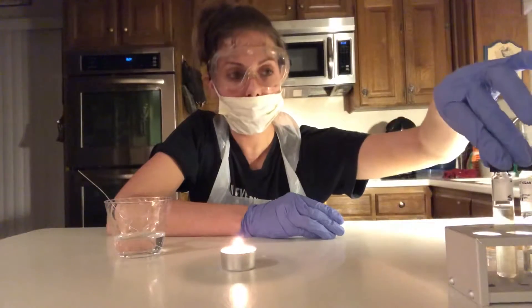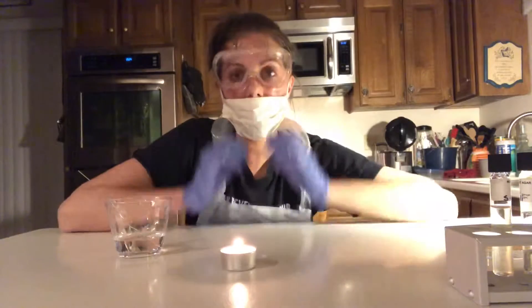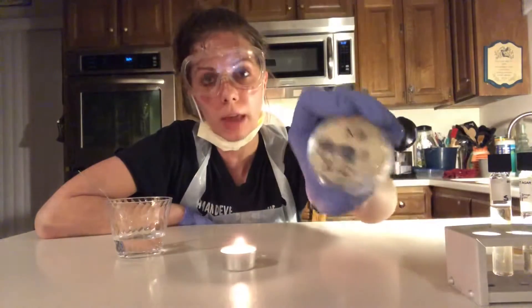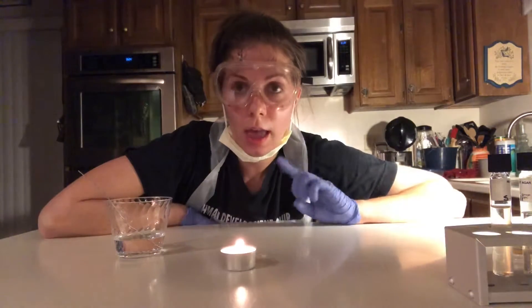So now I'm going to prep the E. coli motility test tube and I'm going to repeat the exact same steps that I did with the S. epidermidis motility test tube. This time I'm going to use a paper clip to collect cultures from my E. coli agar plate and transfer it into the tube. Once I do that I'm going to put both motility test tubes into the incubation location for 48 hours, and I'm also going to take a before and after picture.